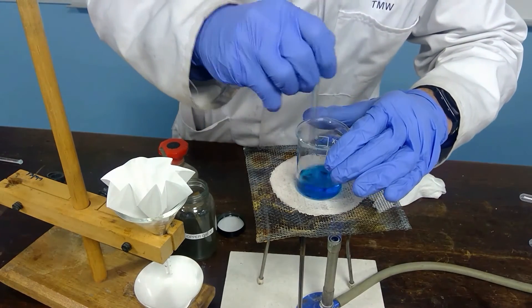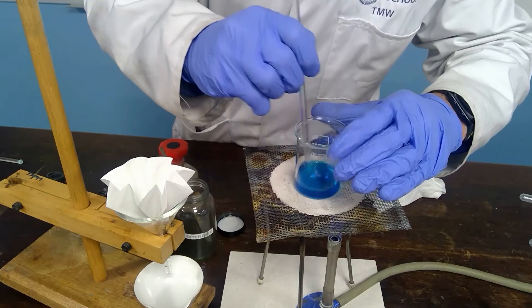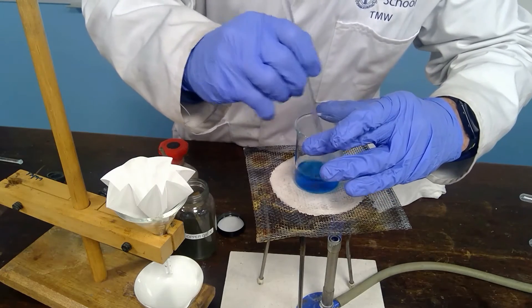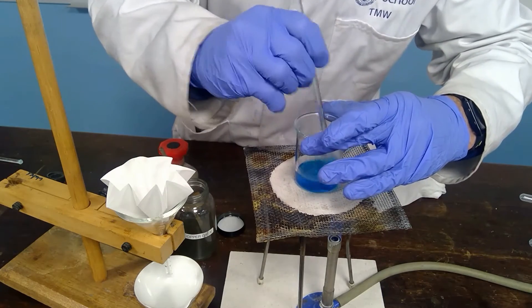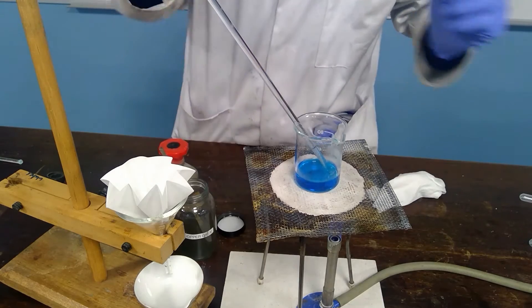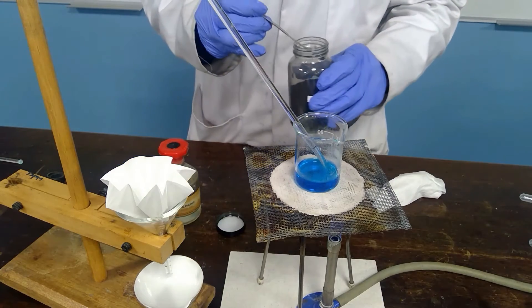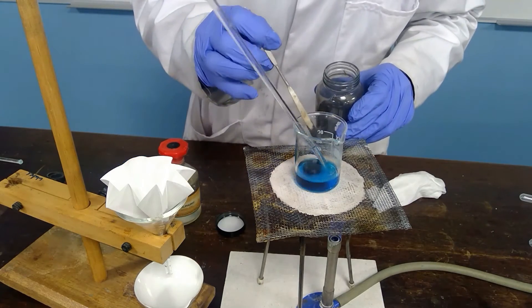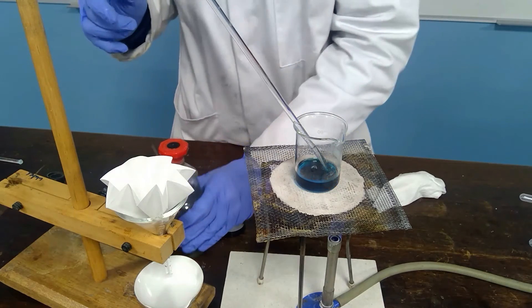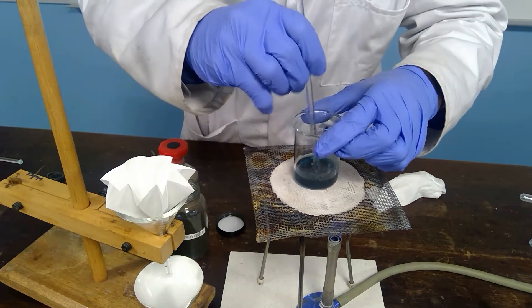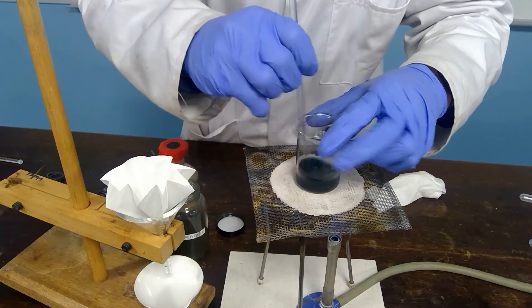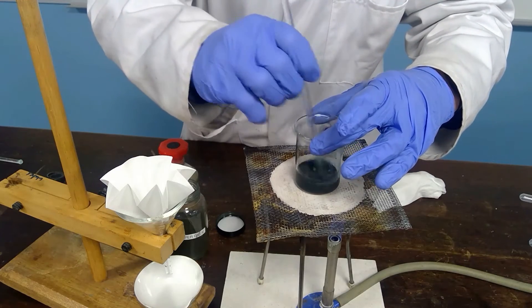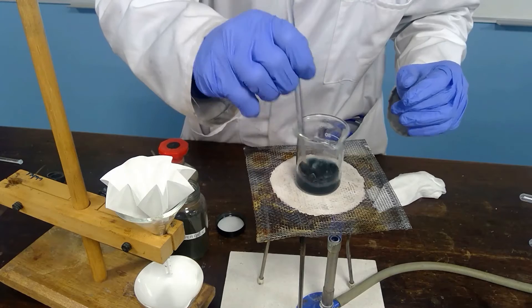So what's happening here? Well it looks as if there's a little bit of the copper oxide left but no on stirring it disappears. So we still need a little bit more of the copper oxide so let's add in there. But we're probably heading towards the end.